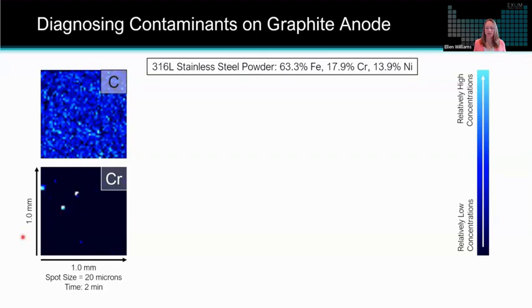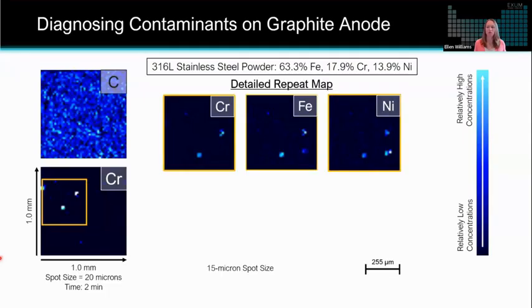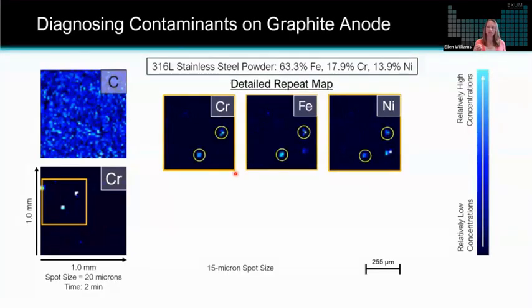But what we identify on the chromium map is a couple of discrete areas with relatively high concentrations shown in those brighter blues. So what we did was, again, a secondary map with a smaller spot size and higher resolution. So in this case, about a 0.5 millimeter by 0.5 millimeter area with a 15 micron spot size. And we can very clearly see that there are two distinct particles with high chromium, high iron, high nickel that correspond to that expected chemistry of these 316L stainless steel powder particles that we knew were on this graphite anode. So this demonstrates the technique's ability to reliably measure the chemistry of contaminant particles.